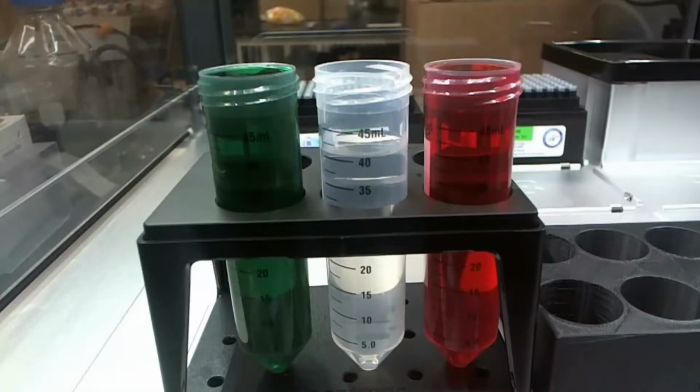Right, this is where you send this here, and that's where we go. So this is our source. This is our destination. Okay. New pipette tip, don't need to worry about that for now. Dispense rate, don't need to worry about that.